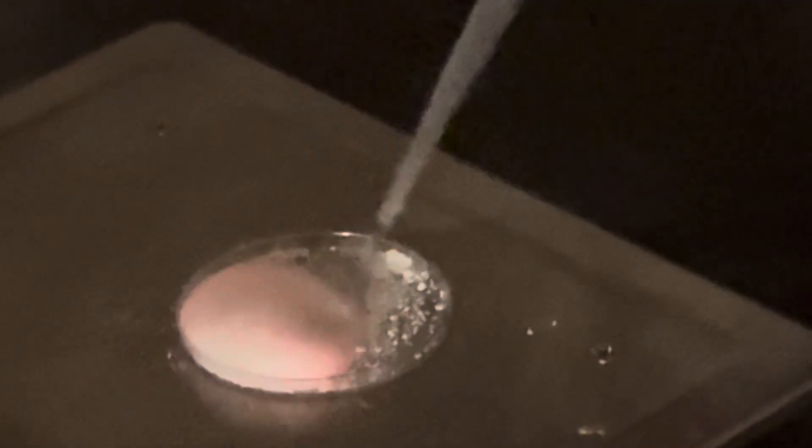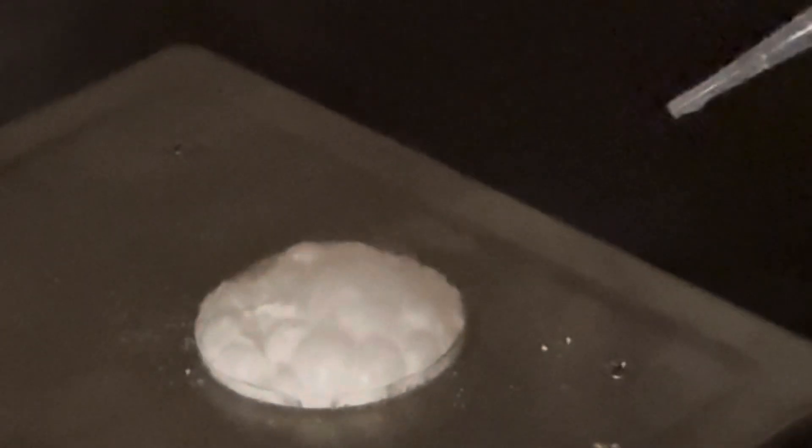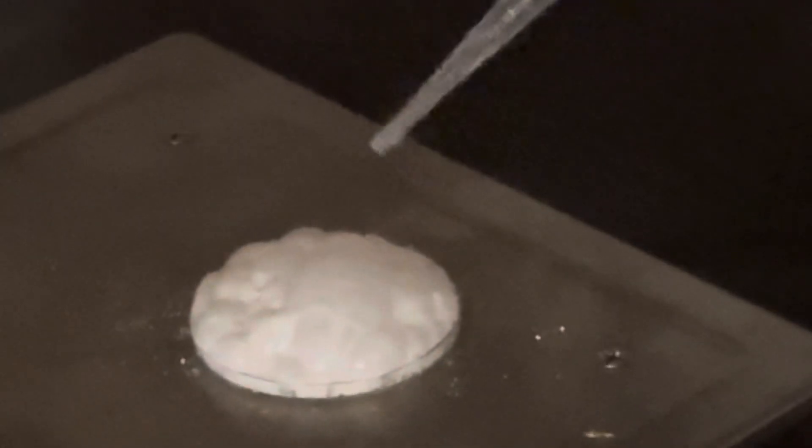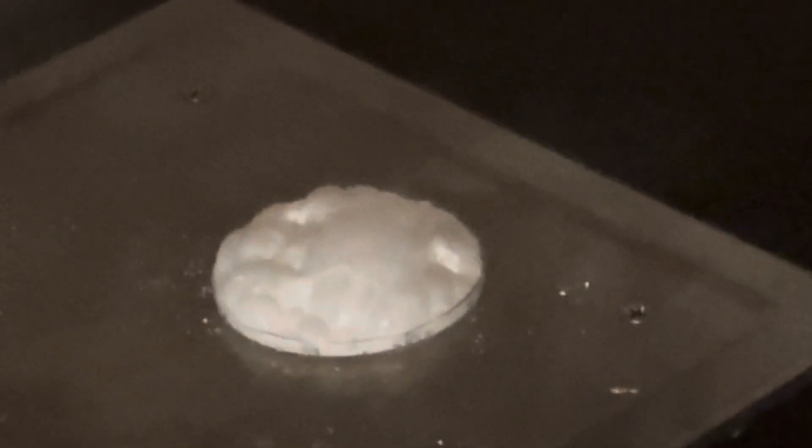Let's see. There it is. Oh, there you go. There it is. That was the red. I saw that. Just at the beginning. Yeah, that worked kind of well. That was actually pretty good. I think you captured it actually. So you want to try it again? Try one more. Yeah, let's try one more. See if we can grind it up really fine and then just dump it on. Alright.